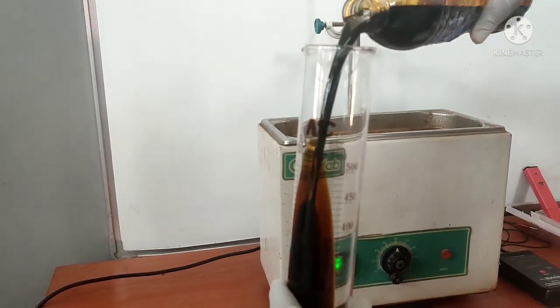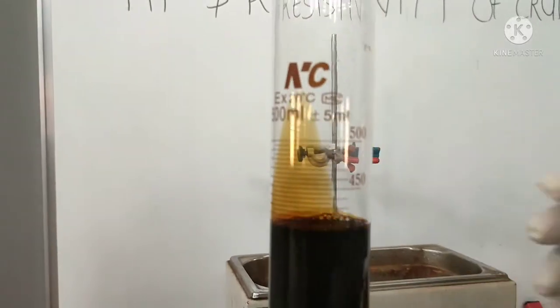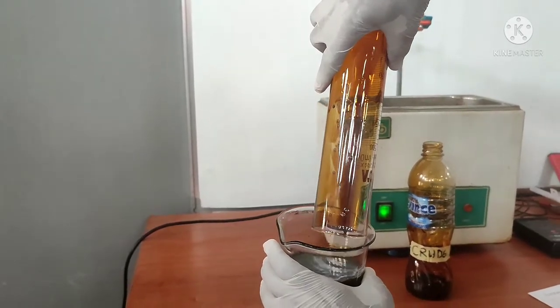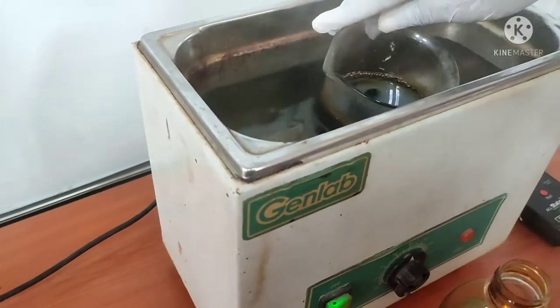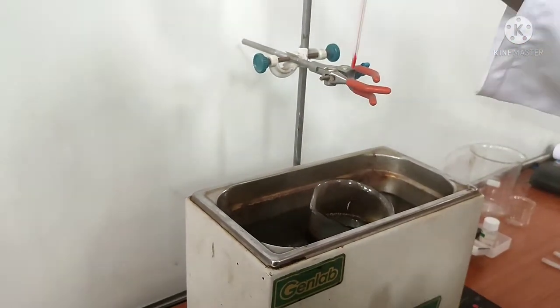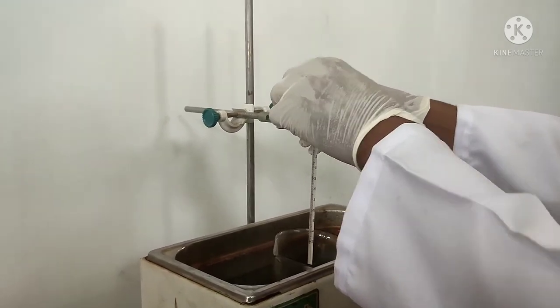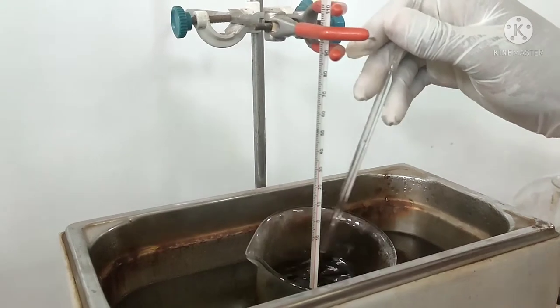We place it into the hot water bath and then clamp the thermometer to read the temperature. We also have the stirrer — use the stirrer to ensure homogeneous and uniform heating.